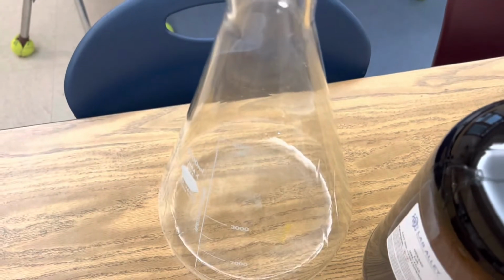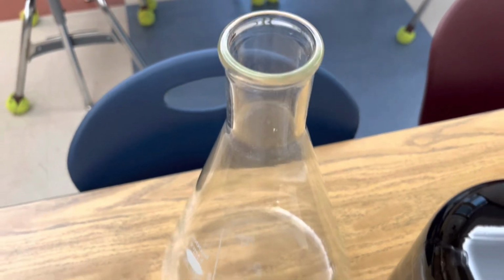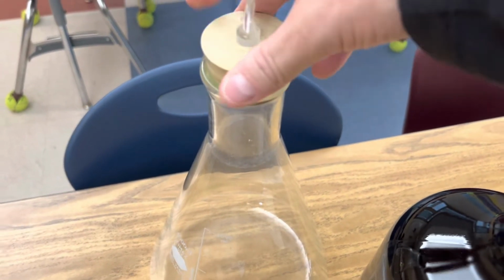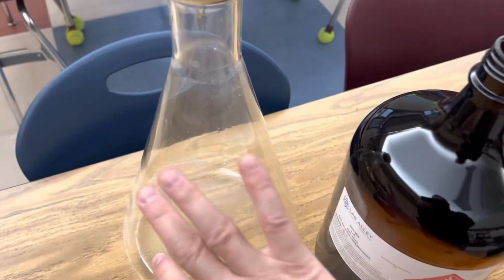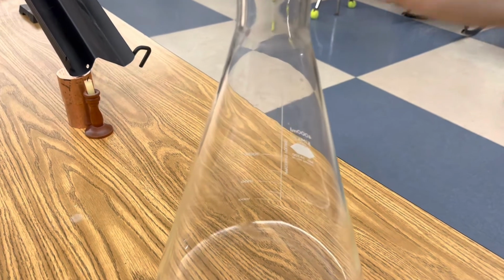And this hexane is going to evaporate very quickly inside the flask, and so you want to plug it. And you want to roll it around in there so it all vaporizes inside. Okay, so to increase the vaporization of the hexane, I'm just going to roll it around so it coats the walls of the flask, and I'm just going to keep rolling this around until it's all evaporated inside.